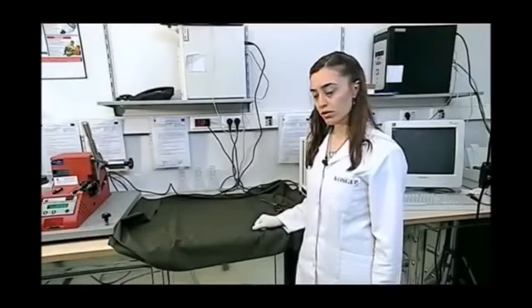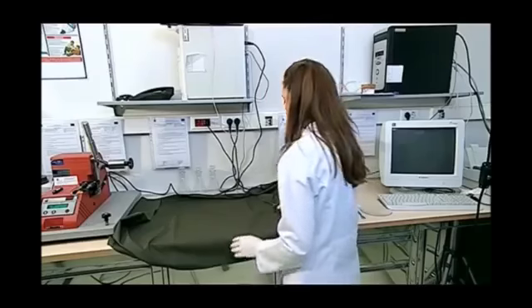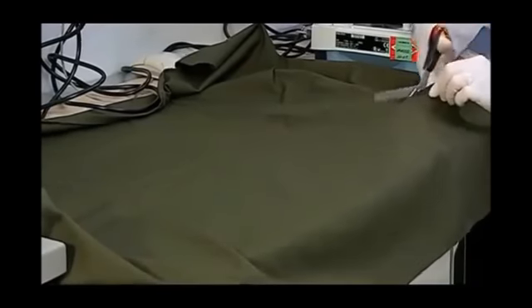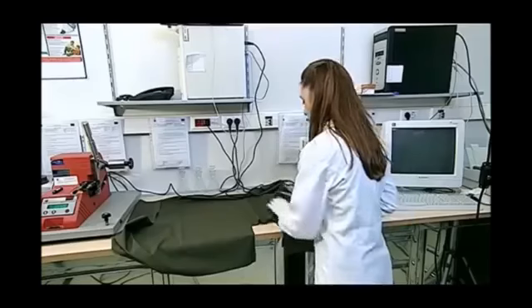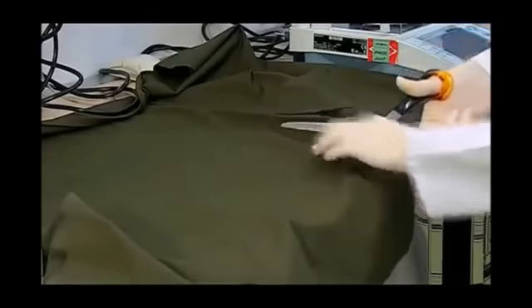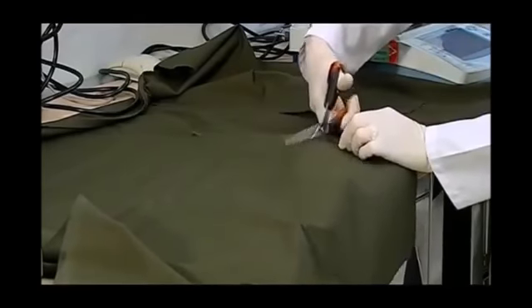During the sample preparation process of the pH test, we first lay our fabric on a flat surface. Then we cut pieces from different parts of the fabric. These parts must be 3 units, and we must make sure that the parts are not too small, for example, less than 2 grams. For the purpose of representing all the samples, we make sure that they contain different warp and weft yarns.